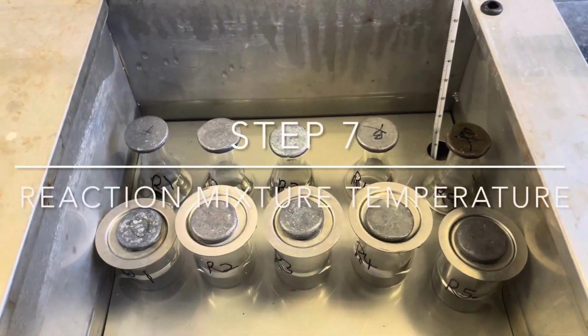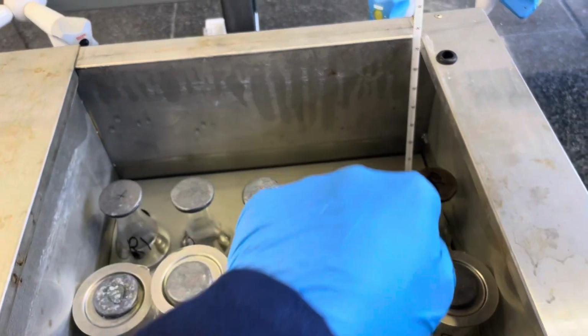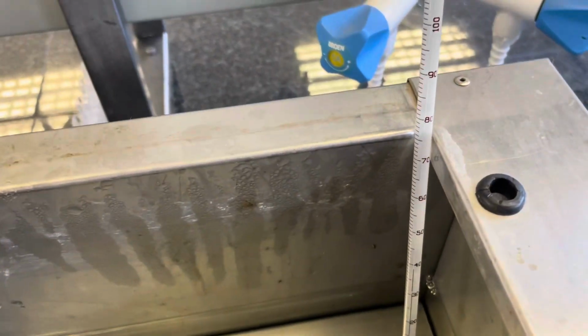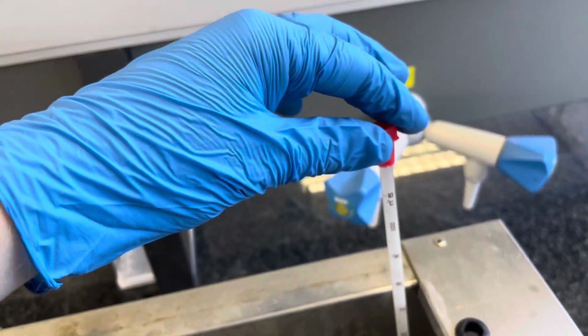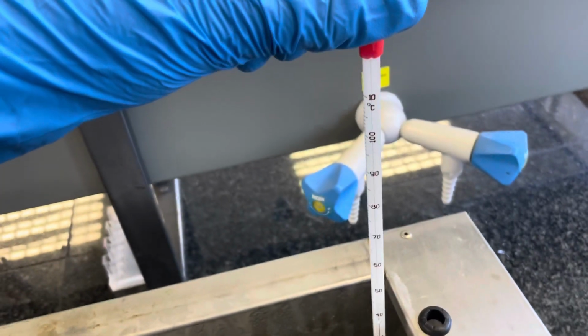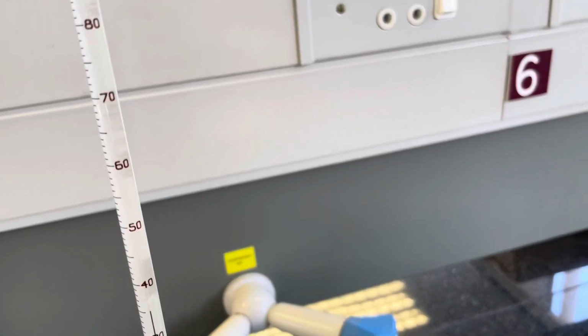After placing your weighted reaction vessels in the water bath, you need to allow them to equilibrate for at least 10 minutes at an appropriate temperature. Note that even though it is specified that this temperature is around 40 degrees Celsius, in actuality it is not exactly 40 degrees Celsius. That is why you need to take the precise temperature from the thermometer, at around, for example, 36 degrees Celsius on our day. You will, of course, do this for your appropriate lab day.